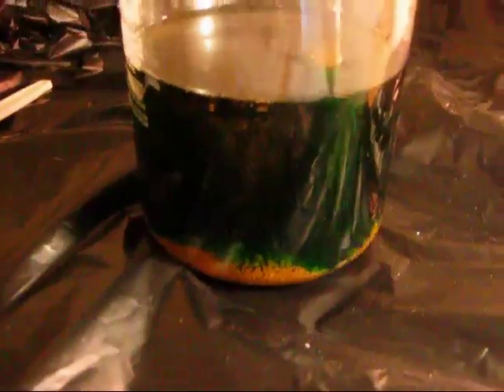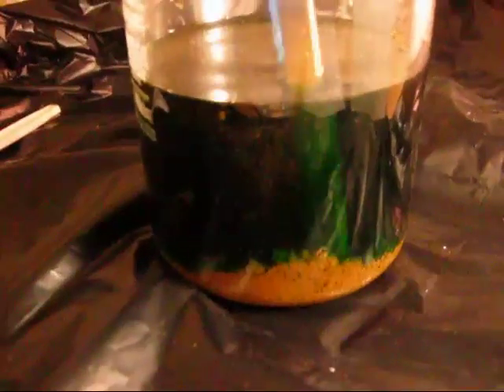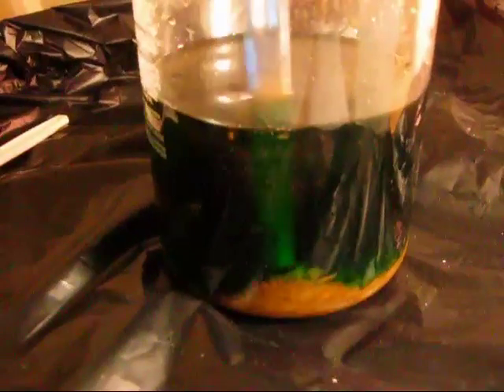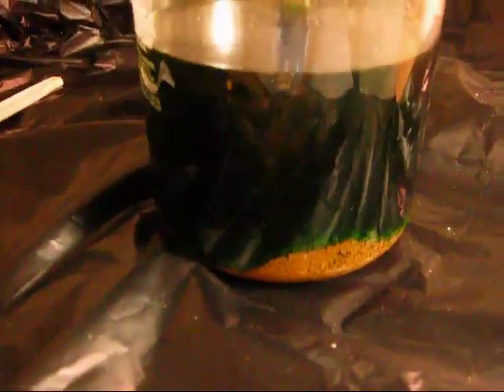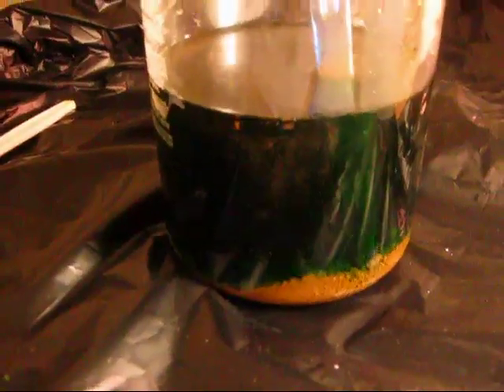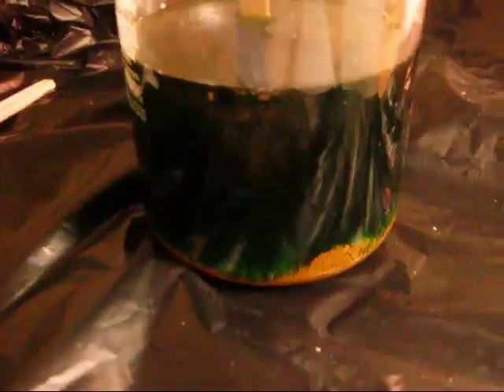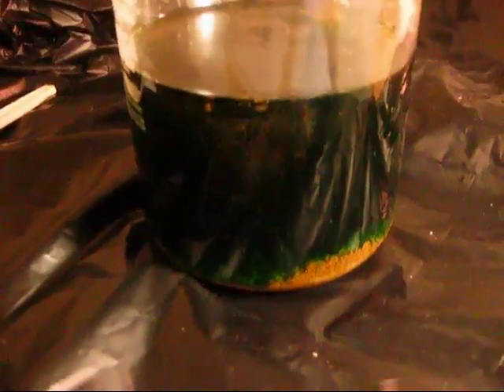This here is the Aqua Regia solution that I had brewing outside the house. Aqua Regia is one of the only solutions known to dissolve gold to its most basic form. This started out as about 2 or so ounces of scrap gold, which is maybe anywhere from 13 to 18 karat.